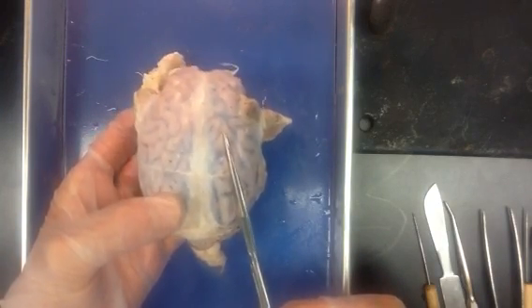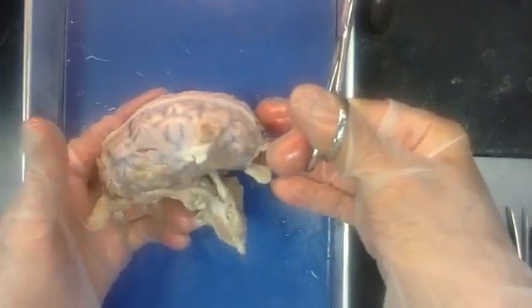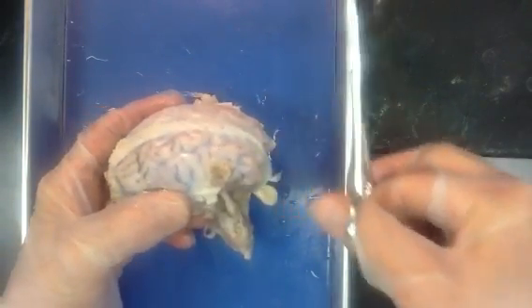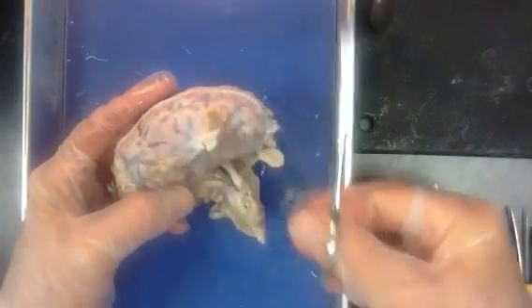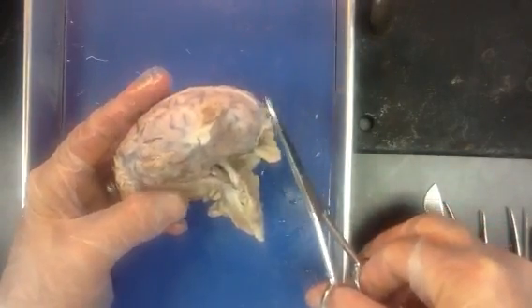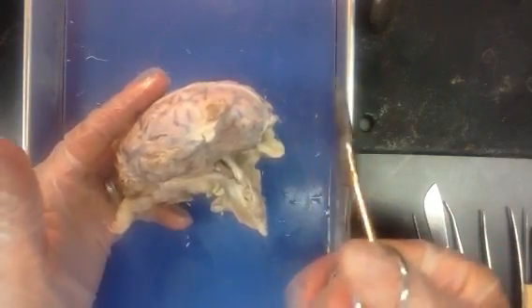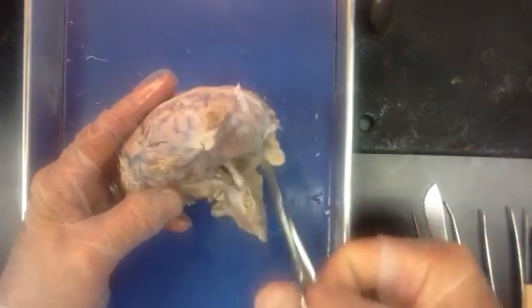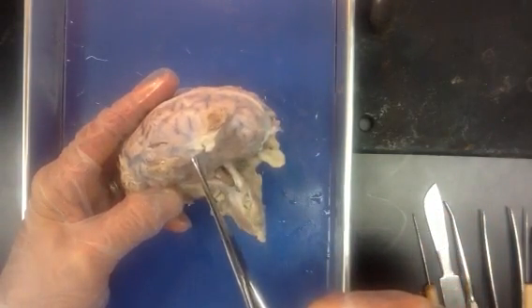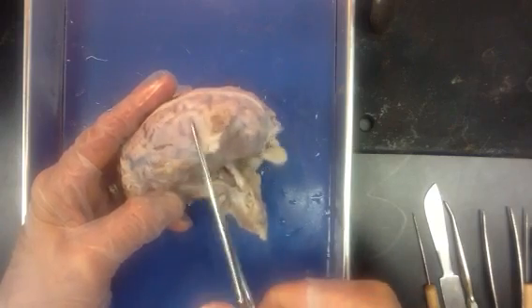Some of you may be familiar with meningitis, which would be an inflammation in one of these layers. This outermost meninge is really tough. It's called the dura mater. Same root word as alma mater when you talk about your college. Dura, like in durable, meaning very tough. So this is one tough mother right here.